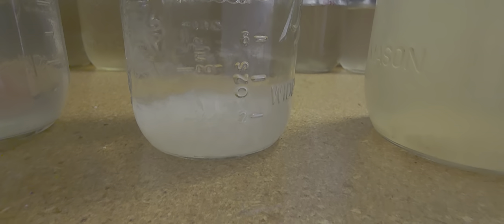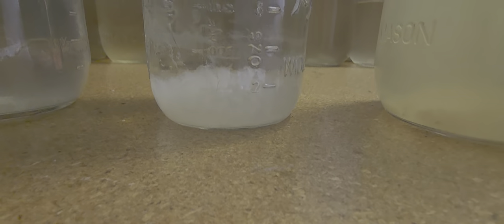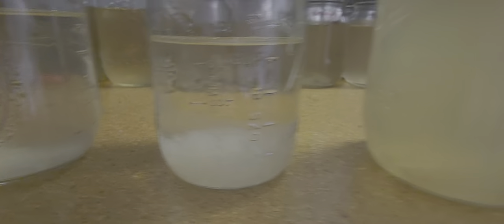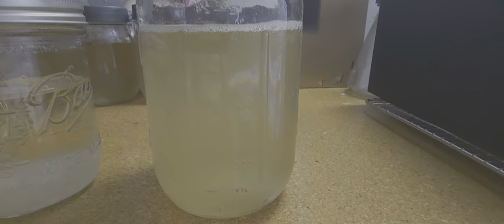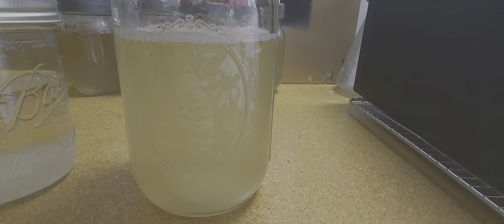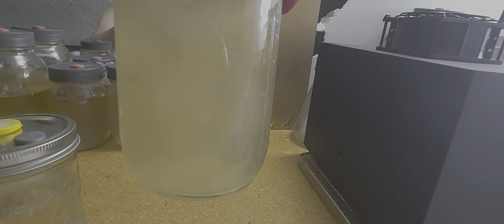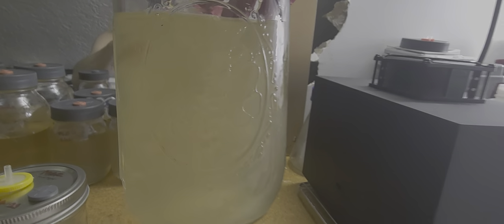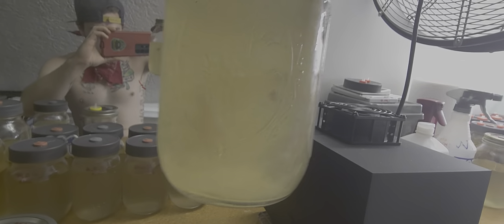Here is a perfect example of what you want in a liquid culture — I have not shaken this up yet for the video, but we'll do that in a second. I've already kind of stirred this other one a bit. Take a look at this one: it was clear before, and that's why I left the other one unshaken. But after shaking it up, see how dirty that is.